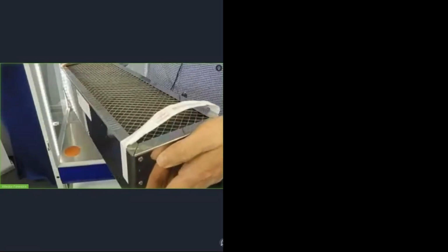And then in the end, this one here in the back, this is the baffle that comes out, and now you see the actual cassette. If I want to replace the cassette, that is my cassette. That's how it comes. The only thing you have to remember is to put it in with the pointer downwards. And what you also shouldn't do is cut off these handles. We had a couple of customers who, when they received it, thought it's kind of labeling and cut that off. You can easily put it in then, but on the way out, it's a bit more tricky because you will have to use something like pliers to go below there.